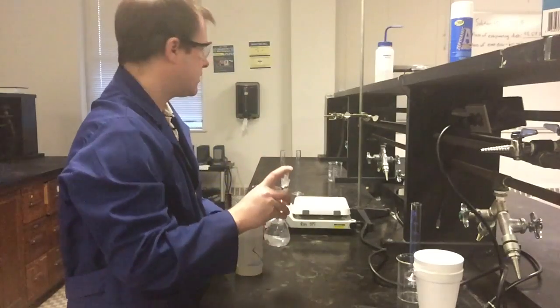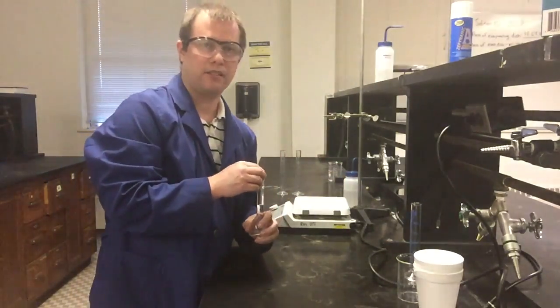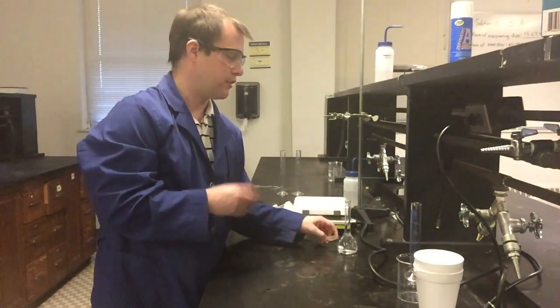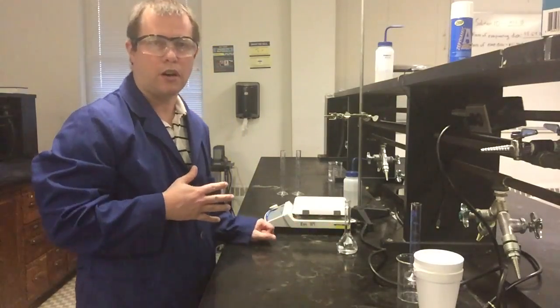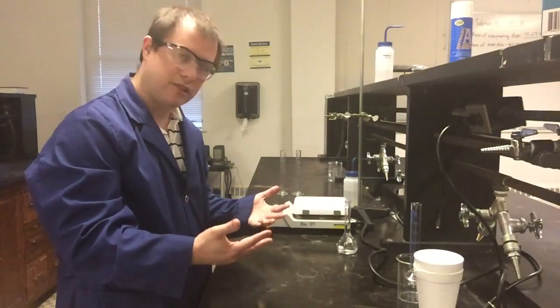So the next part of this is that I'm now going to be reacting this acid and the base, and the only thing that's going to be different from the first time is I don't have to heat anything. Right? The first part of this experiment we had hot water and cold water. This time I'm going to have basically just an acid and a base. They're both going to be approximately room temperature.